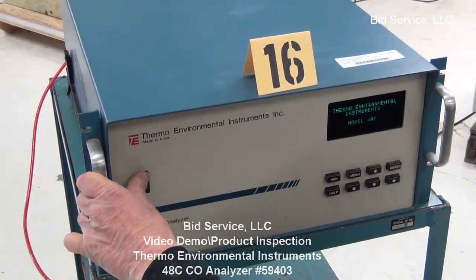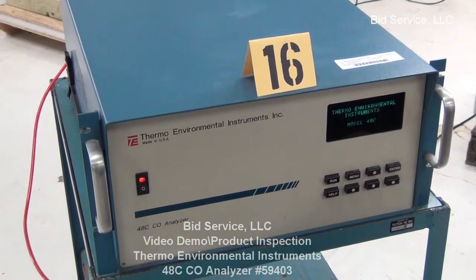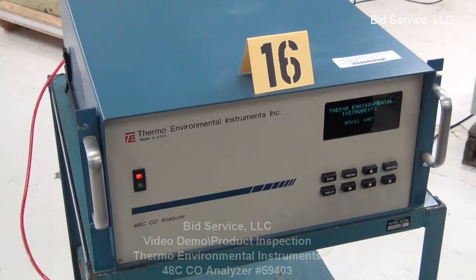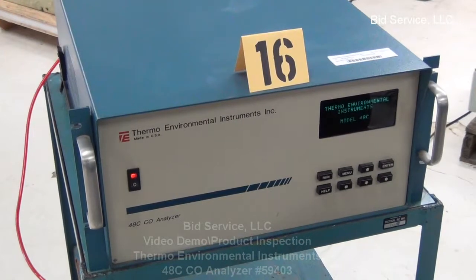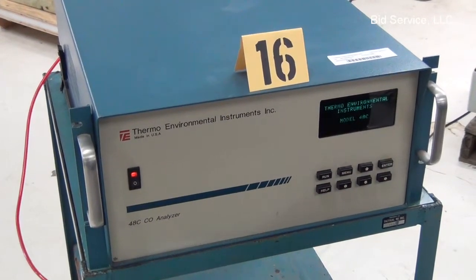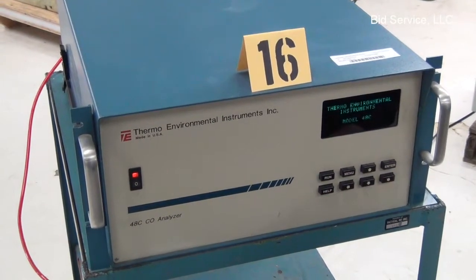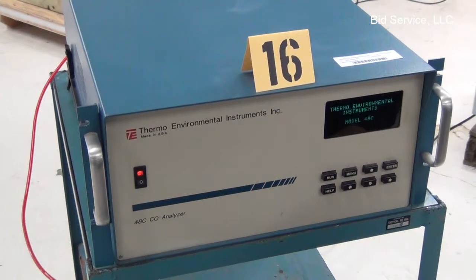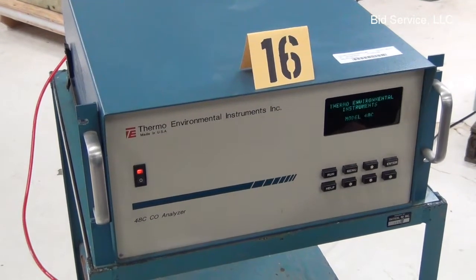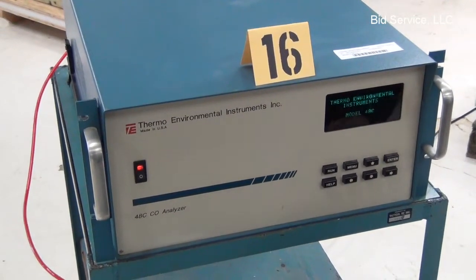Upon power-up, it goes through a self-test of all of its components, including its microprocessor-based CPU board. After about 35 seconds, it will automatically come up to the run mode.